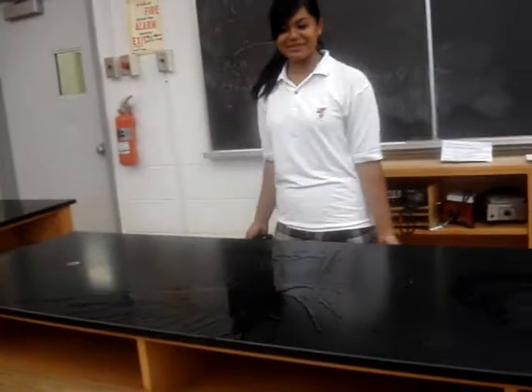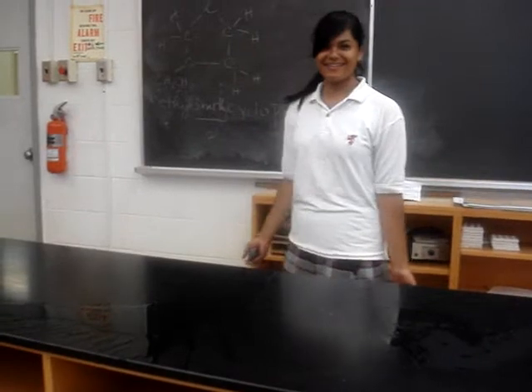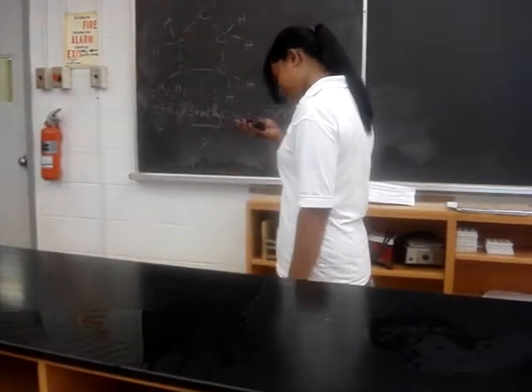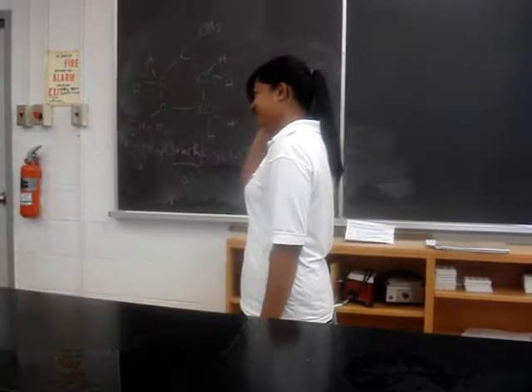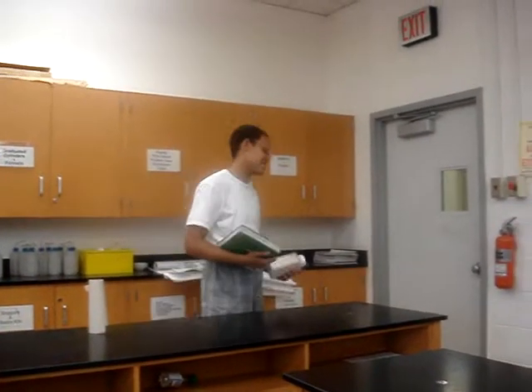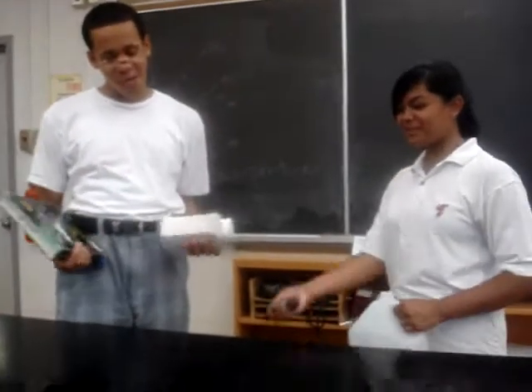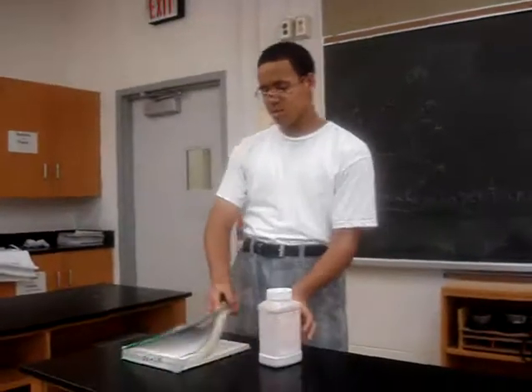Oops. What am I supposed to do? Call JAH. I know, I'll call JAH. Hello? Okay, bye. Hi, JAH here. Oh, I'm so glad you came. Oh my god, an acid spill. Don't worry, I got you. And my textbook.